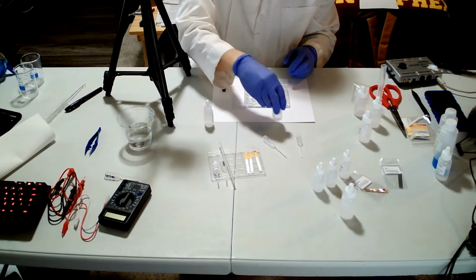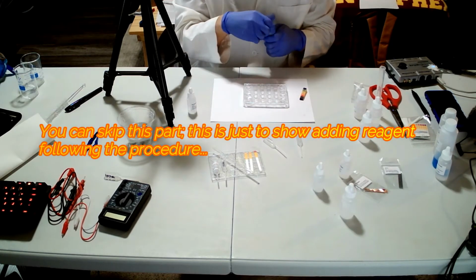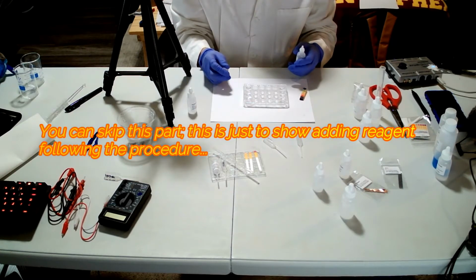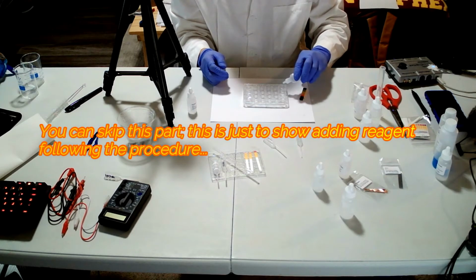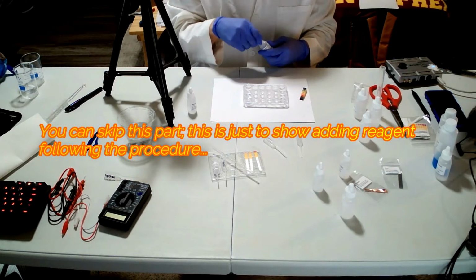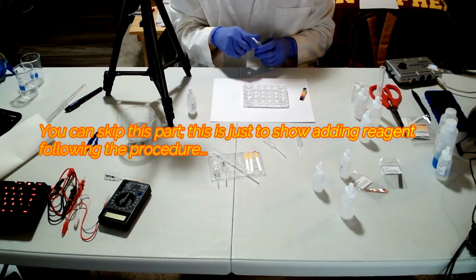And sodium hydroxide here. For D1 I need to add HCl. Yeah, 1 drop. D1, 1 drop to create 0.1 molar of the solution of HCl.